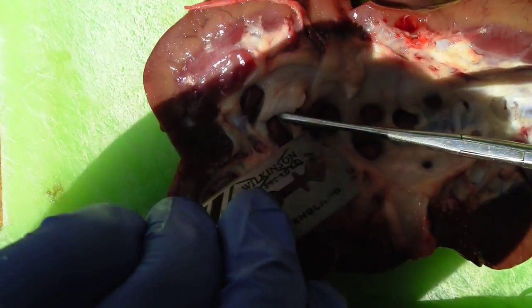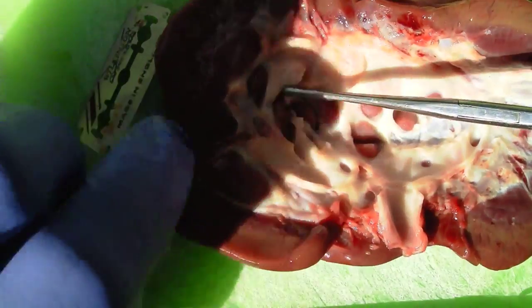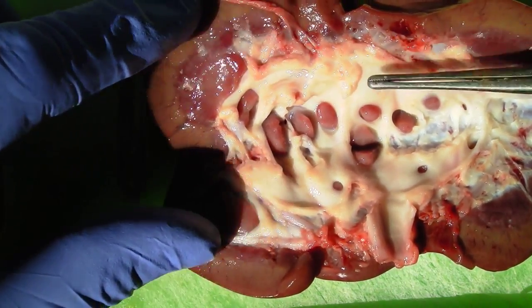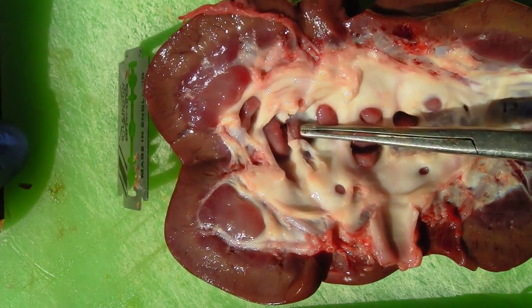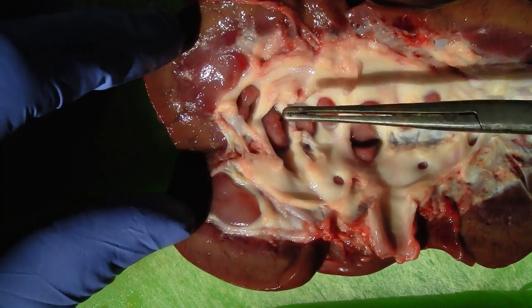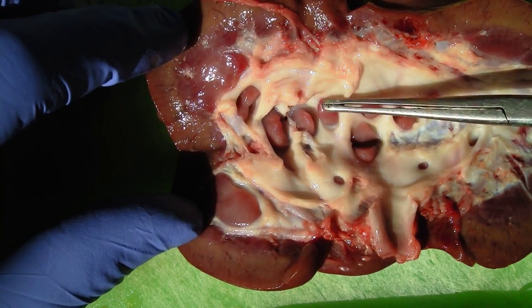When we dissect away some of the fibrous tissue, we see another medullary pyramid — or the apex of the medullary pyramid.